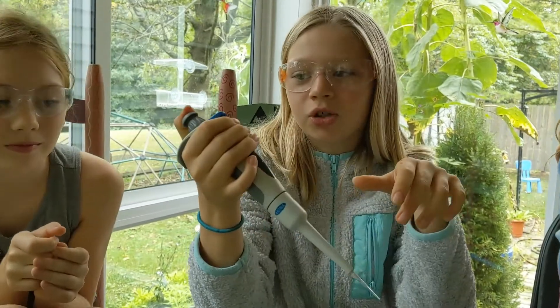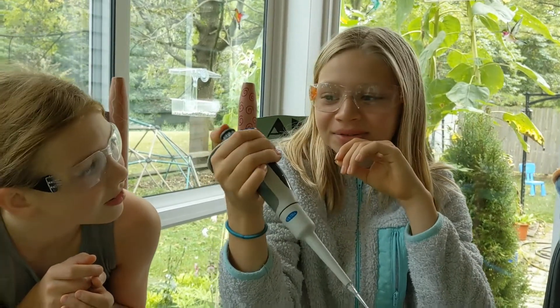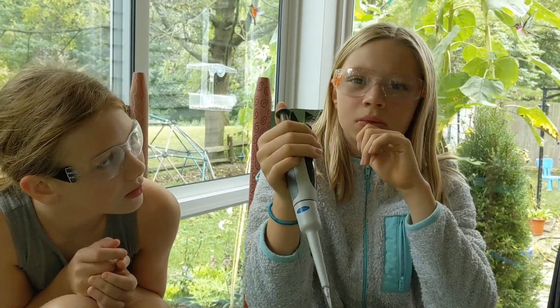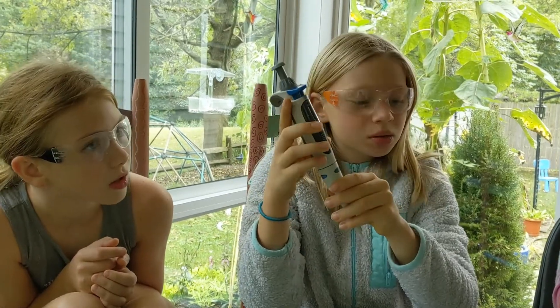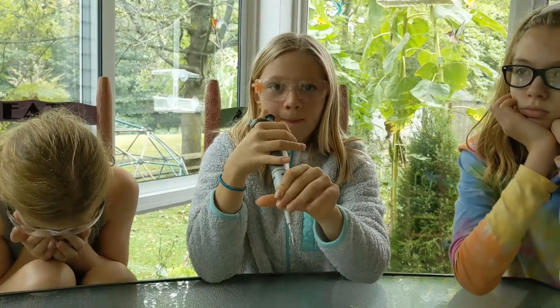Maybe you do just one pump of the 0.5 to 10? But you need 15. So what if you did it with two droplets instead of one? Which micropipette would you use? The small one. And how could you get 15 by pipetting twice from the small pipette?